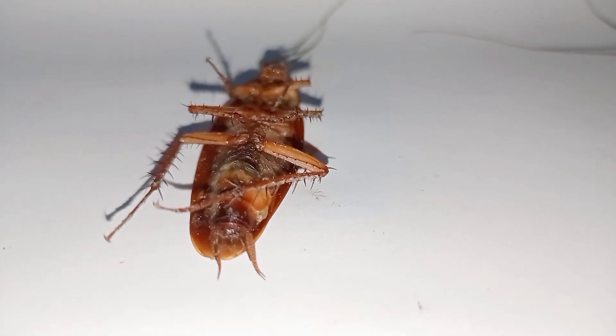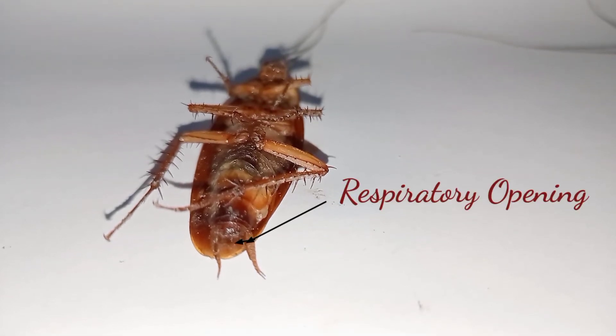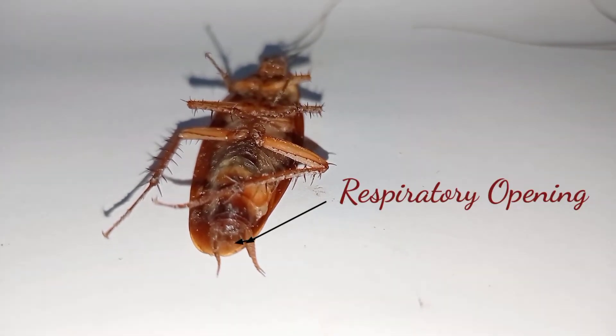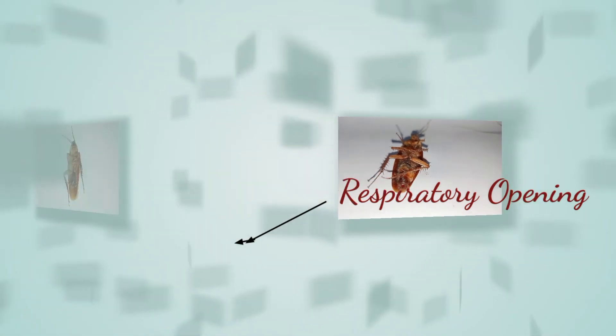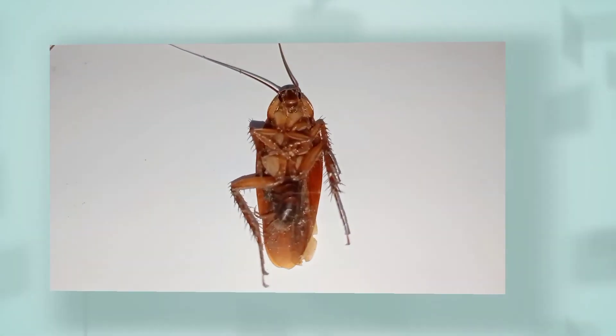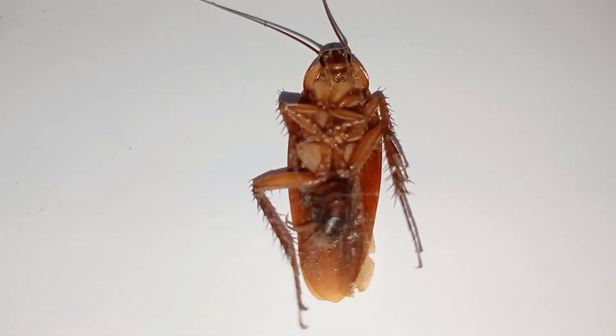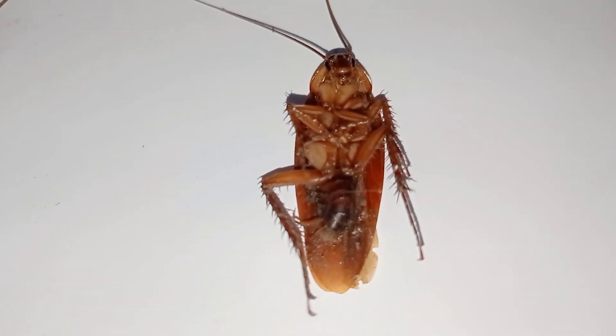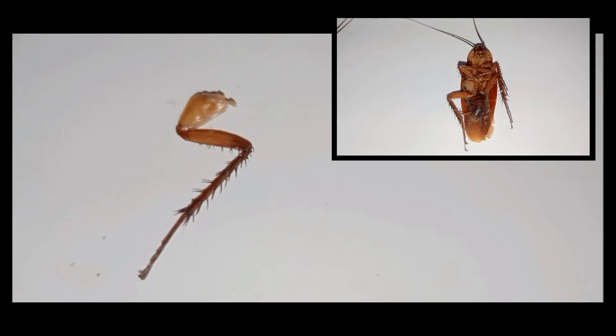And here, we can also find the respiratory opening of the cockroach. And now, let's cut a portion of its leg to see its other parts.